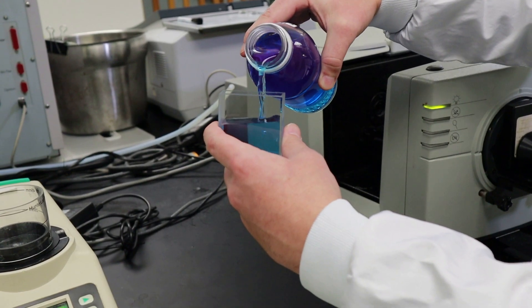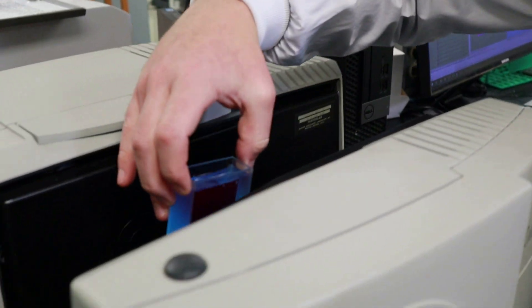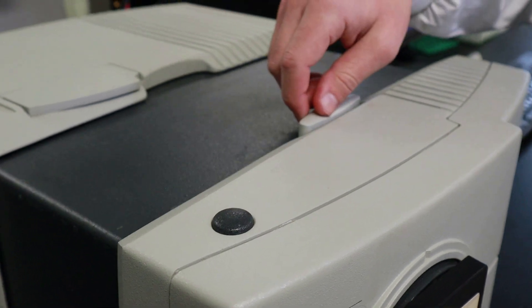Then, we measure the hue of each sample using a colorimeter. This initial measurement will serve as our baseline.